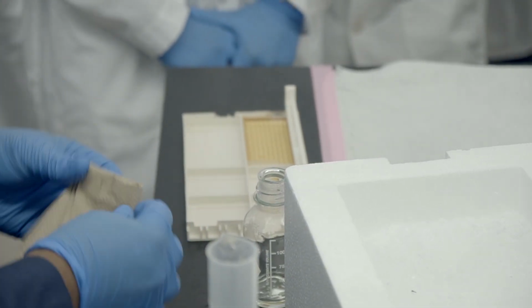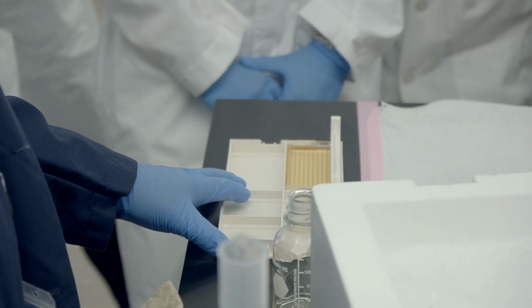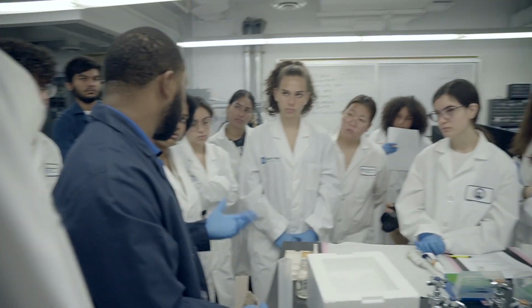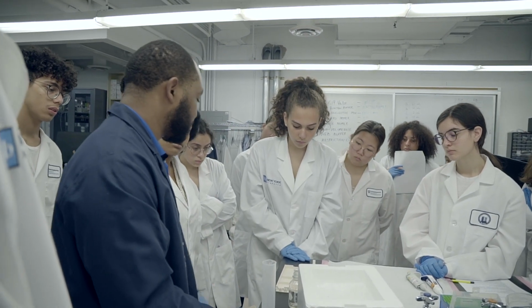And I'm going to go fill this with water again, let it cool off before I touch it with my hands again. But I'm going to leave the gel uninterrupted, and in about 30 minutes it should be solidified. It's stable though, so it doesn't have to be used immediately. It'll be good to go anywhere from 30 minutes to 24 hours even.